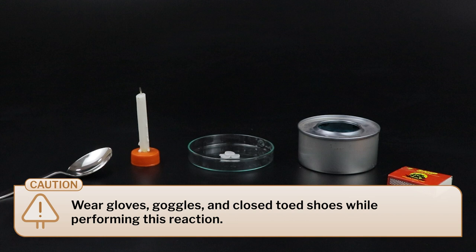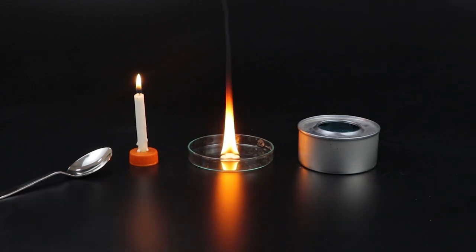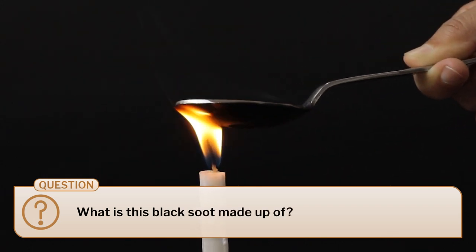Take the fuels in different plates and light each one of them on fire one by one. Are all the flames similar? Hold a spoon over each flame. You will observe that soot is collected on the spoon from only the yellow flames and not the blue ones. We then explained to the students that we saw two kinds of combustion reactions — one that is clean and the other that is sooty. The sooty kind is also called incomplete combustion, because in this reaction carbon dioxide does not get formed; carbon remains as carbon or forms carbon monoxide, leaving the combustion reaction incomplete.